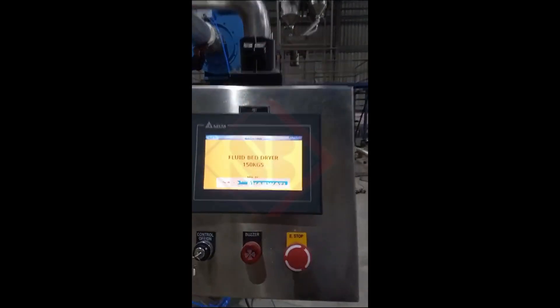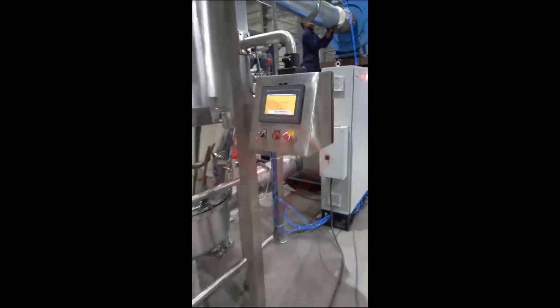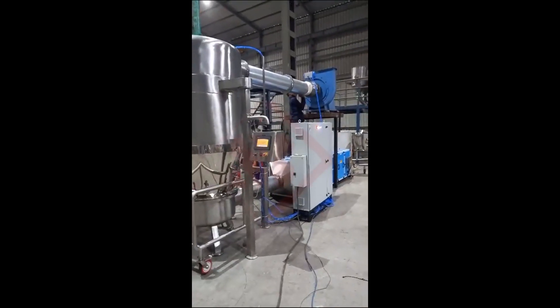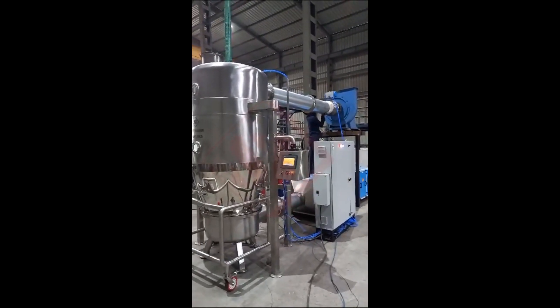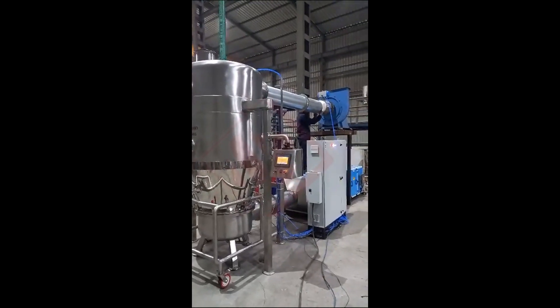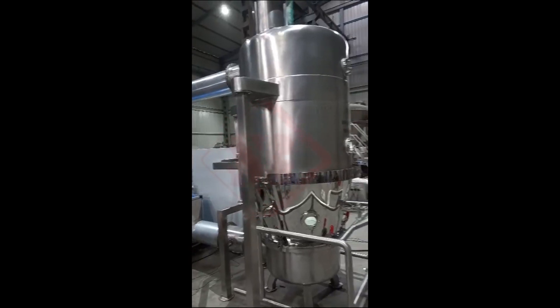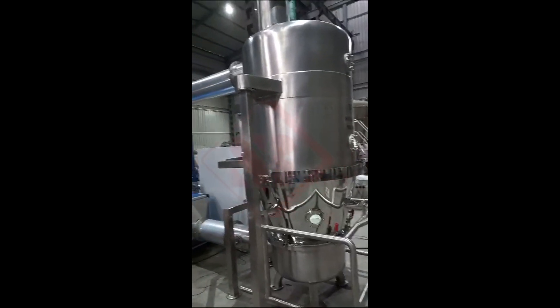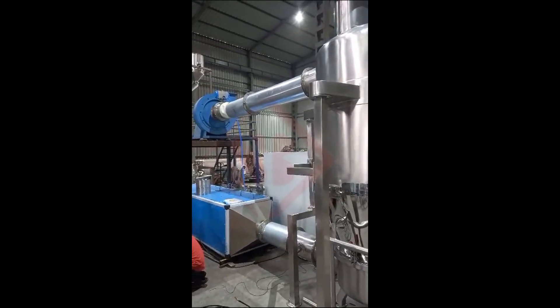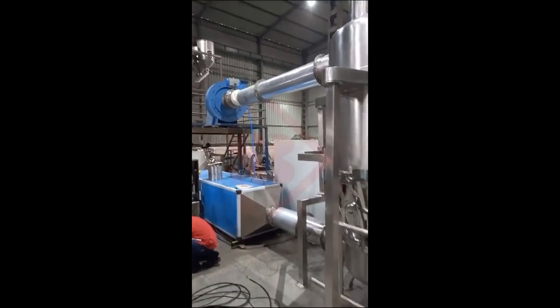Here's how a fluid bed dryer typically works. Loading: the wet or moist material to be dried is introduced into the fluid bed dryer's chamber. Fluidization: a stream of hot air or gas is blown through the bottom of the chamber. This air or gas passes through a perforated plate or membrane, causing the particles to become suspended and fluidized. The fluidization creates a rolling motion among the particles, preventing them from sticking together and allowing even drying.